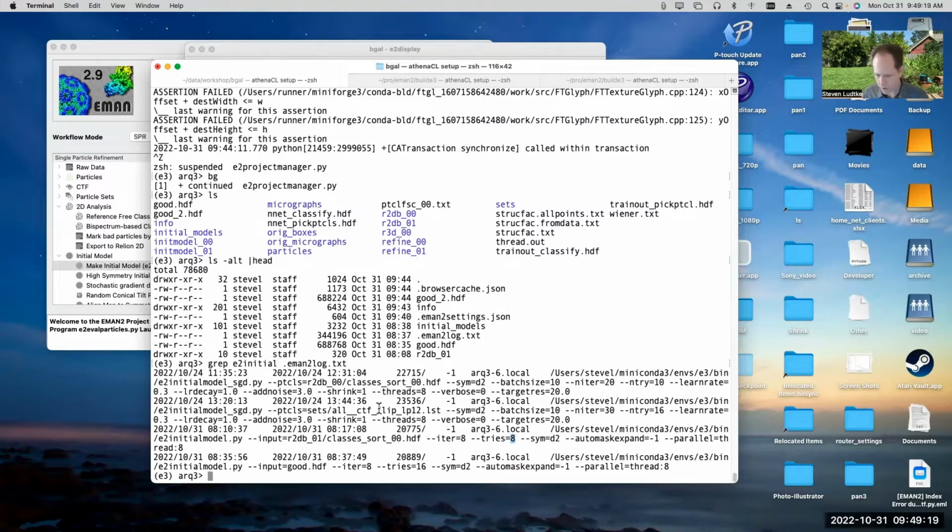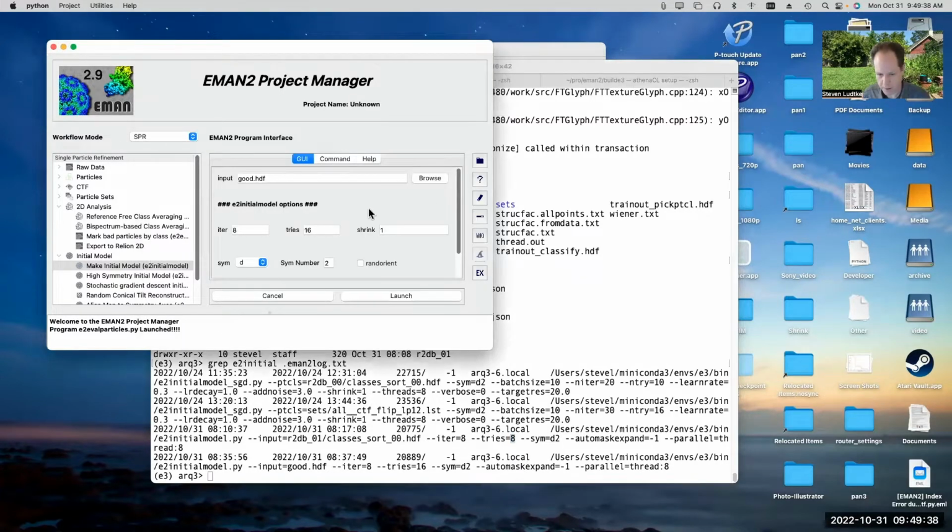Anyway, you can look at this file if you want to get any details about the history of the jobs that you've run and stuff like that. In theory, you should be able to look at this log file and see the exact commands that you used to produce any particular file that you generated during refinement. So this serves as sort of a scientific log of what you've done in the project. Of course, it can't keep track of non-EMAN2 commands.